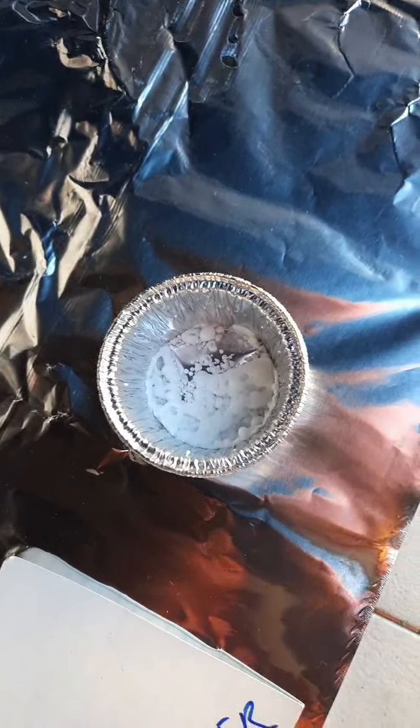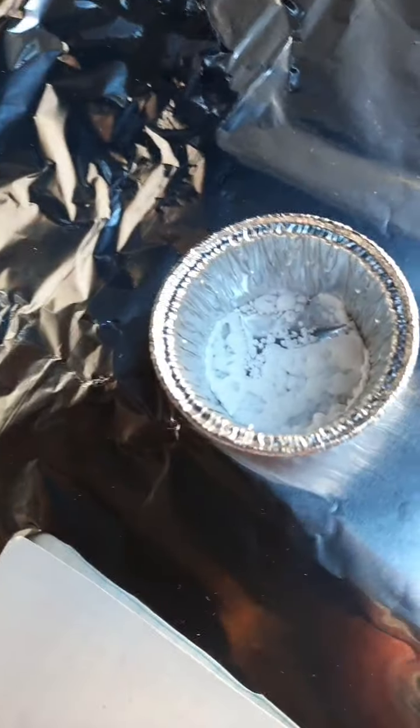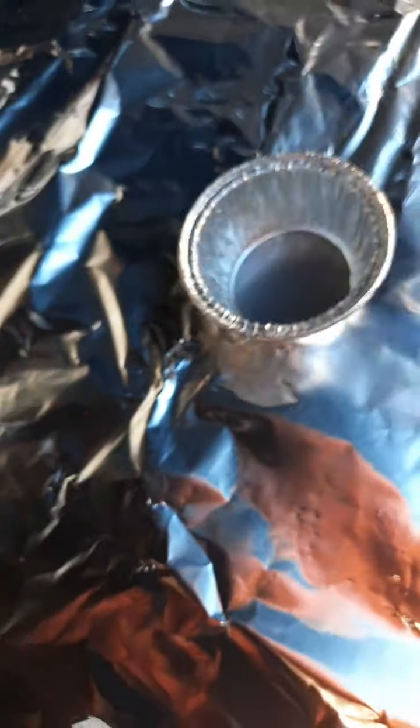Oh, oi, Boris. Oh, blunder. Very much blunder. Well, it happened in experiment. Very much blunder. So take note of what Boris did wrong. See how I clamped this thing? Sometimes when you clamp it, it almost slips out. That is very annoying. So Boris is clamping it like this.